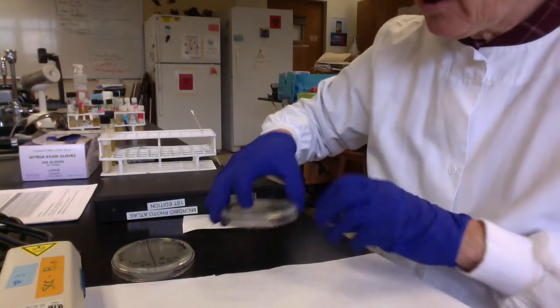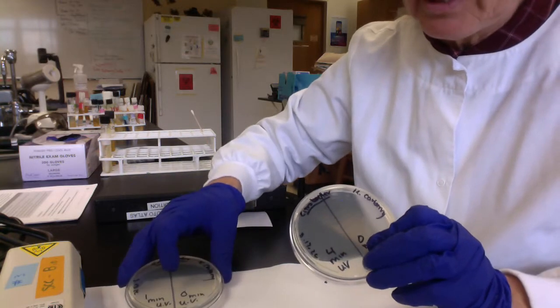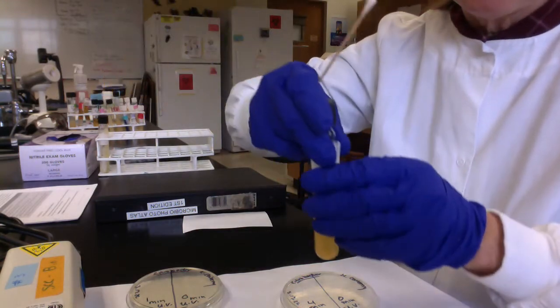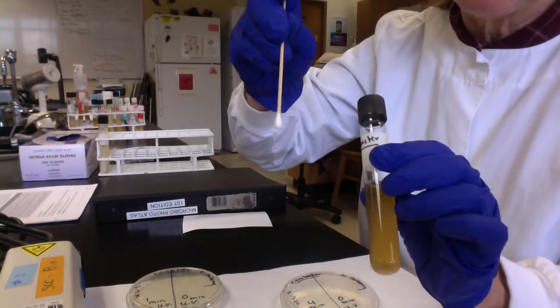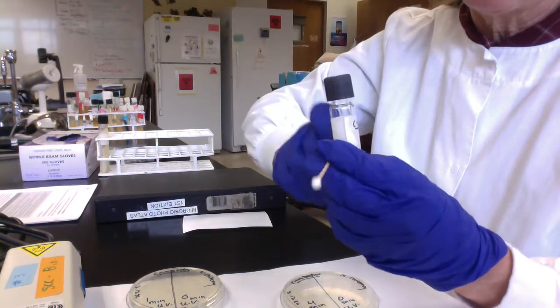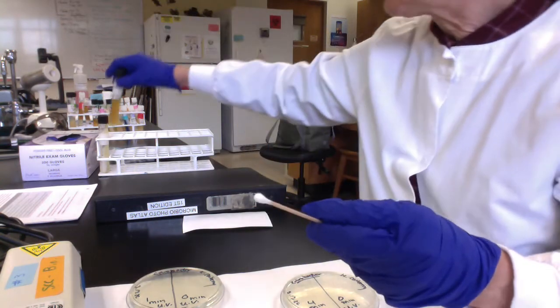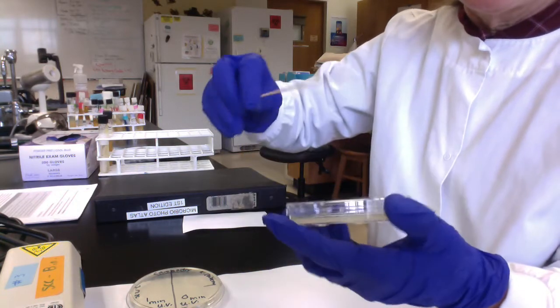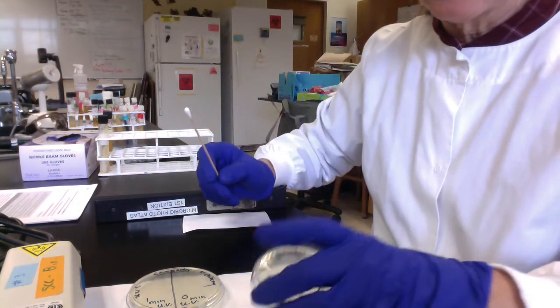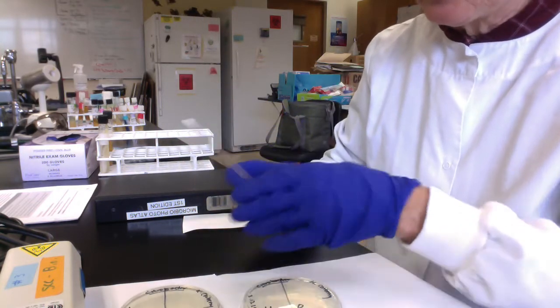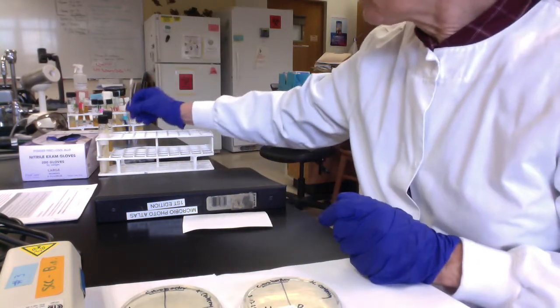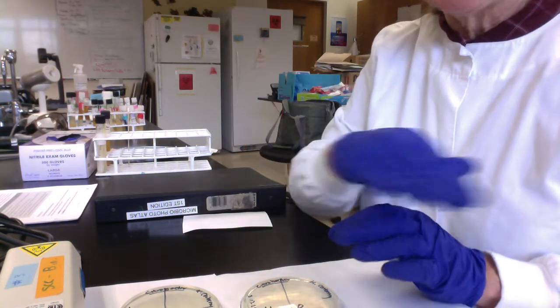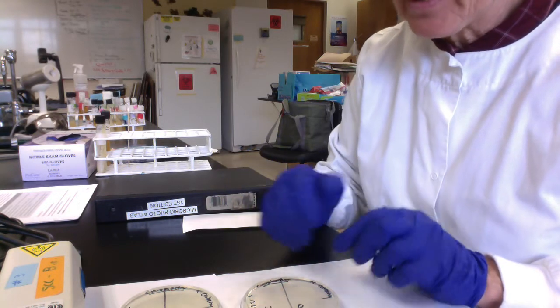We had to prepare our plates. Often what people do is they forget to swab their plates. You recall in an earlier video, we showed how we swab our plates to get confluent growth. We use sterile swabs, dip them in our broth, in this case it's citrobacter. We take off the lids, and then we swab the surface of the plate in three directions. Our goal is to get confluent growth. We want the bacteria so crowded together that when they start growing and dividing, all of their colonies will touch one another, and that will create this lawn of bacteria. It's like frosting the surface of the plate.